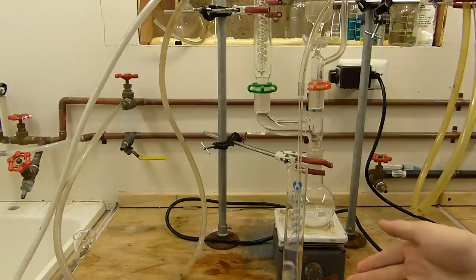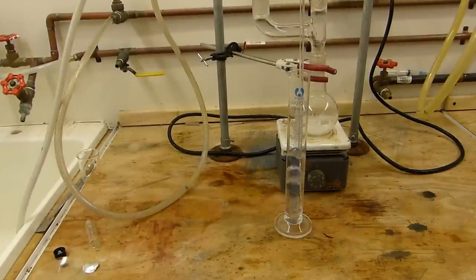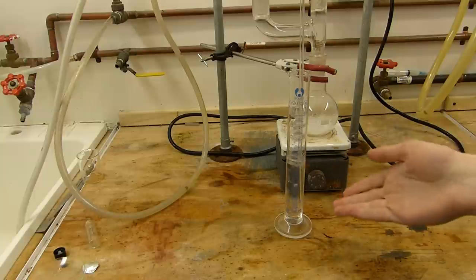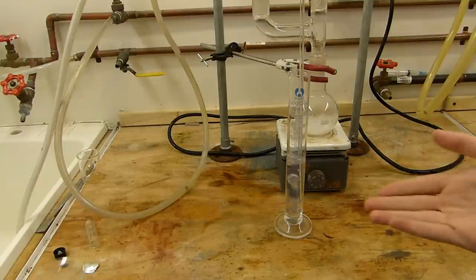At first none of the ammonia is going to dissolve in the water, or at first none of the gas is going to dissolve in the water, because it's primarily air and not ammonia. We need to wait for the ammonia to purge through the system and start dissolving in the water. You'll be able to tell that based on the size of the bubbles that are breaking at the surface.